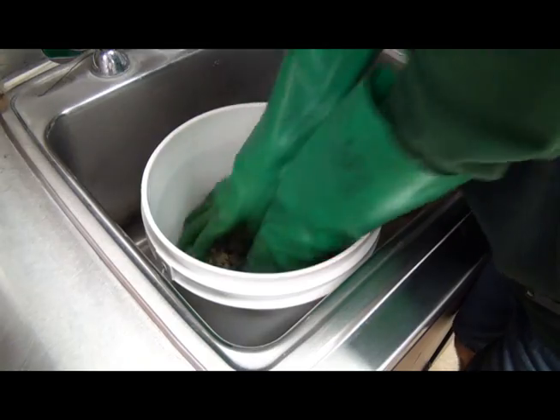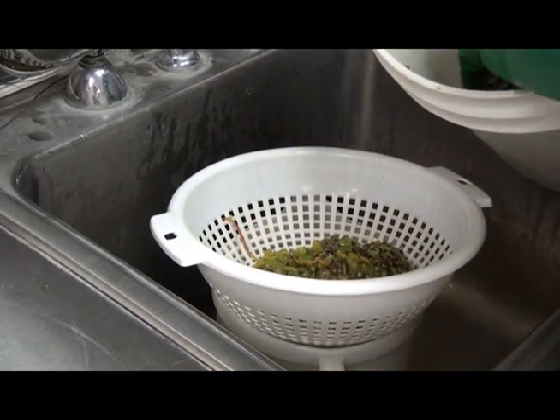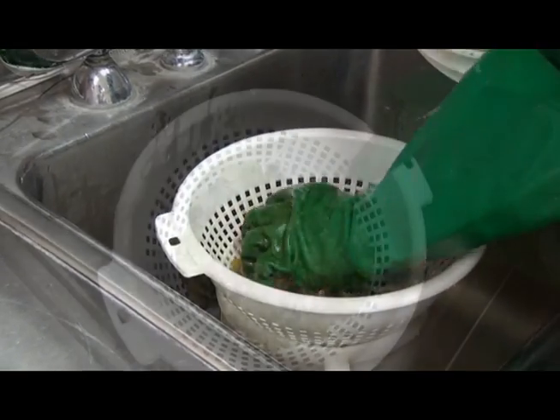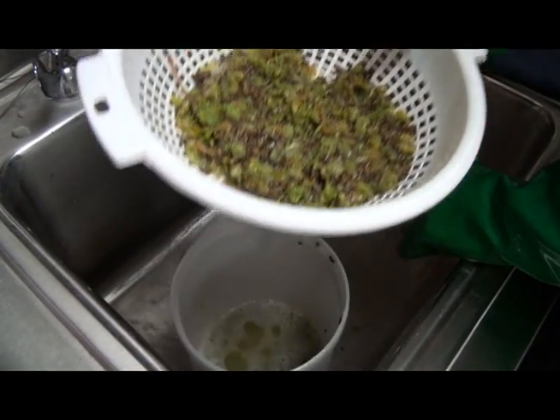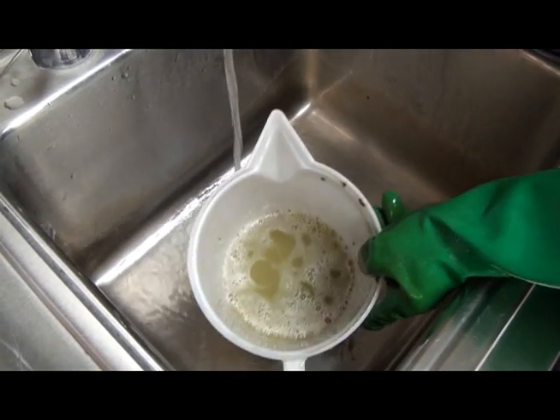Crushing can be done manually by placing the grape clusters into a clean strainer. With gloved hands, crush the grapes thoroughly, capturing the extracted juice into a clean container. Mix the sample thoroughly to provide a homogeneous sample, and then allow the solids to settle.